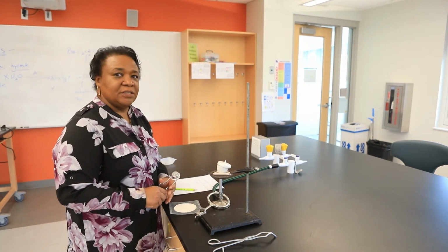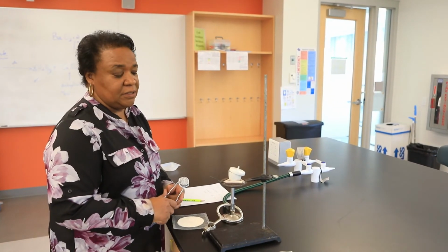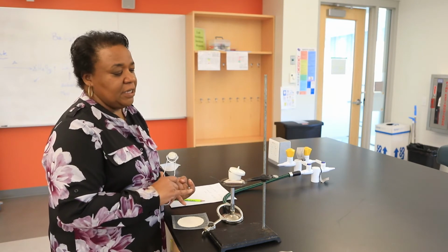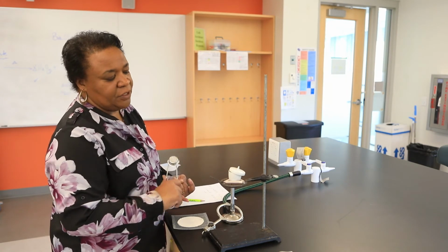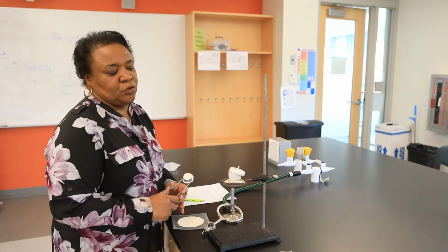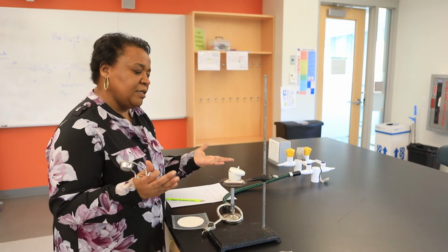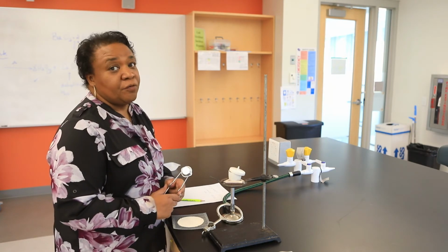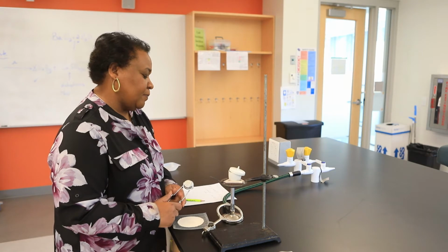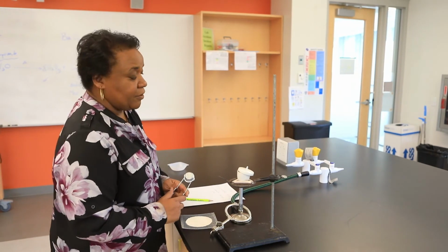Keeping in mind that the lid is going to be slightly ajar in the beginning for several reasons. We want to make sure that the water is slowly evaporating, but of course the lid must be open for that to occur. Please do not, if you set this up on your own, open that lid completely. Why? Because there might be splattering, and then you might lose some of your starting material. Likewise, we're going to be heating this gently, again to avoid any splattering.